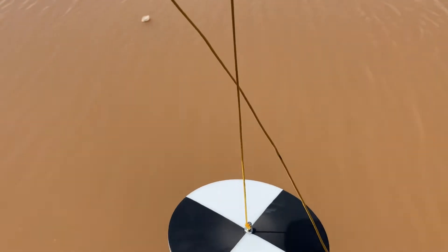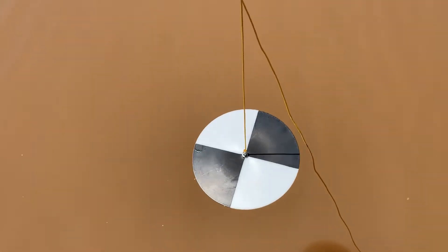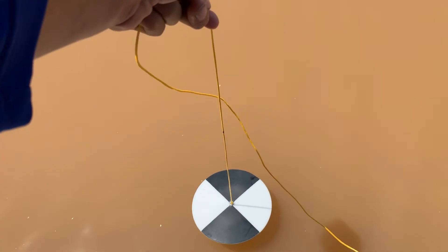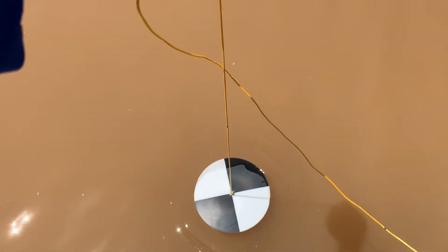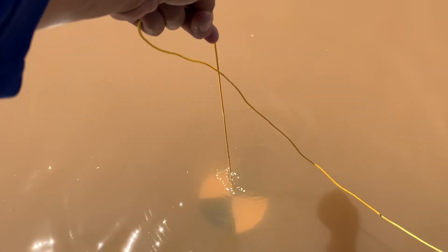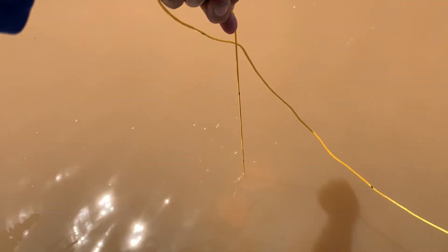This is especially useful whenever you have a turbidity issue like this. To use it, lower the Secchi disc into the water — it's attached to a rope — and lower it down until you cannot see the disc any longer. Once you can't see it, stop, then raise it back up until you can see the triangles again.